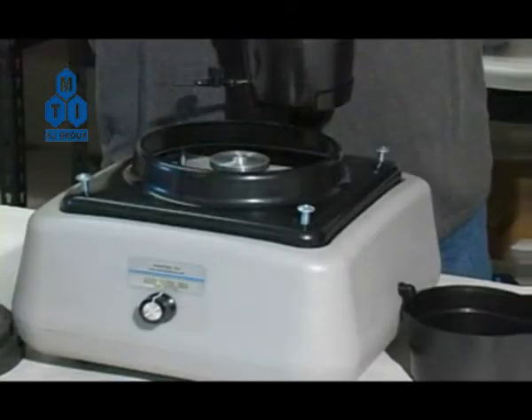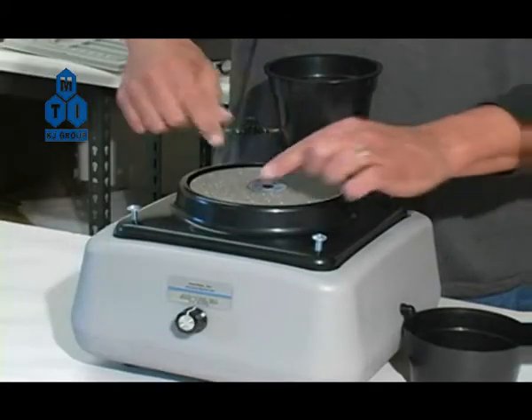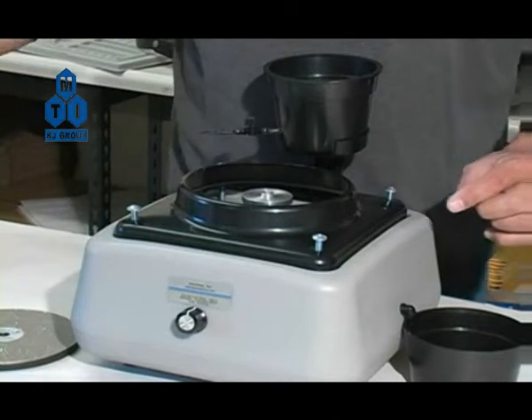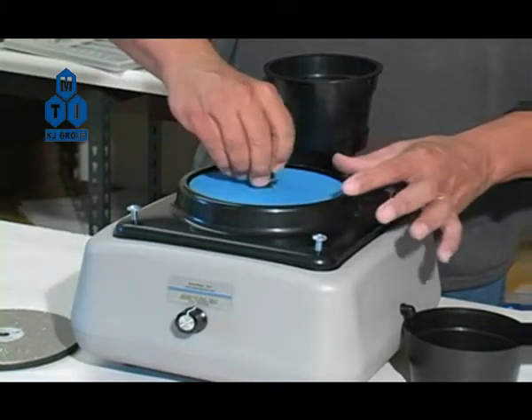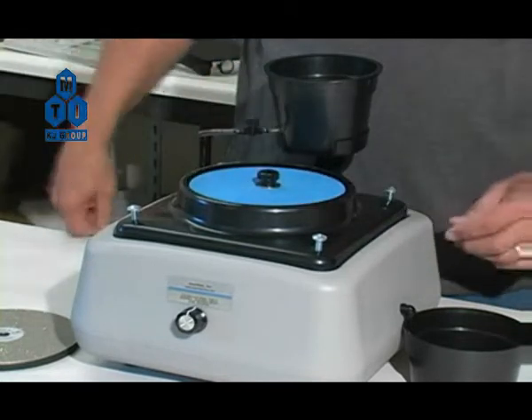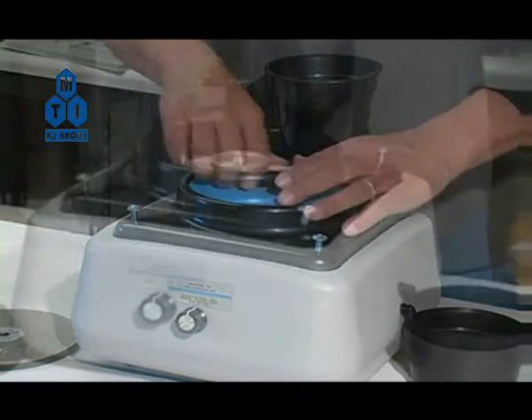Note: these screws are pre-adjusted at the factory. Press down gently on one side of the disc until it lifts on the other so that you can easily remove it. Align the new disc over the arbor, seat it down firmly, and then snug and tighten the arbor screw back onto the arbor.